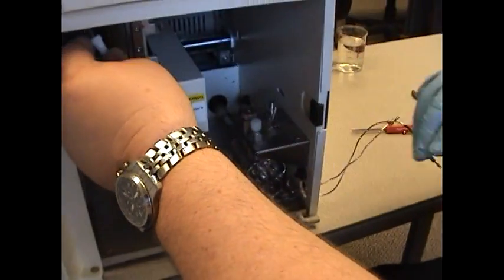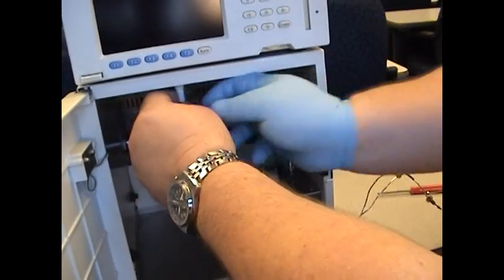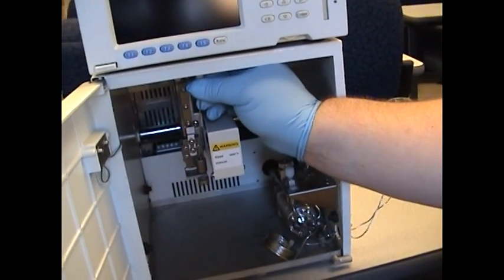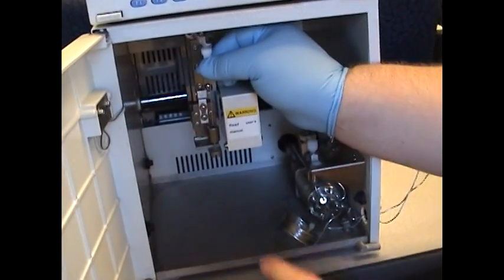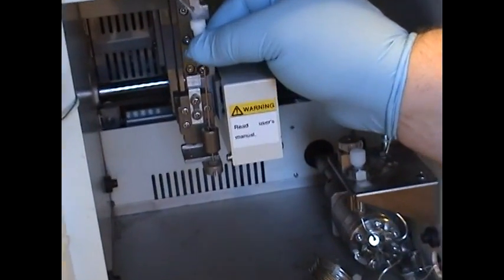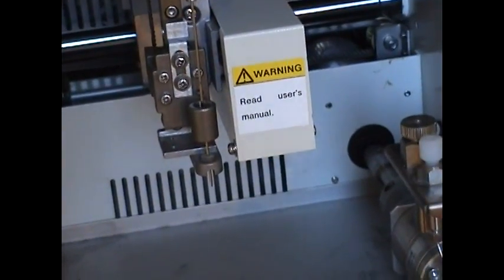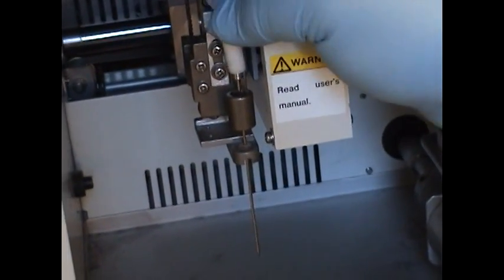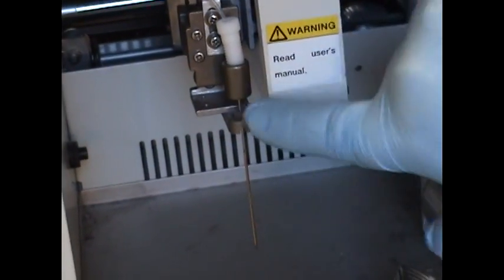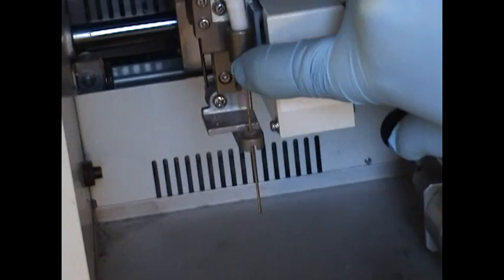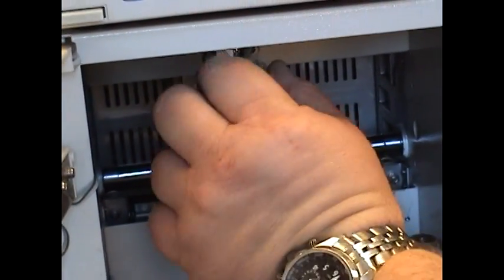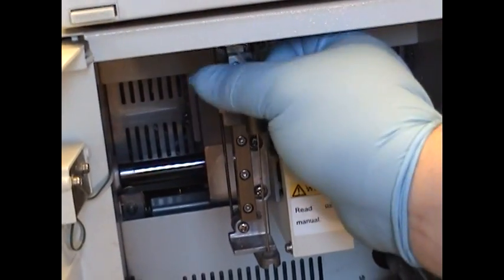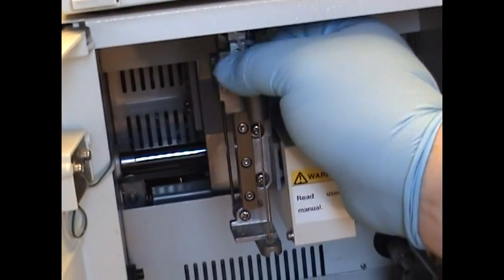Now we come back over here. We're placing the needle inside of the needle guide. Going down here. Push that all the way to the bottom. Now we can move this back up. With the power off, it will move freely. Now we screw this back down. It should go in gently and easily. It should not be bound up in any way.